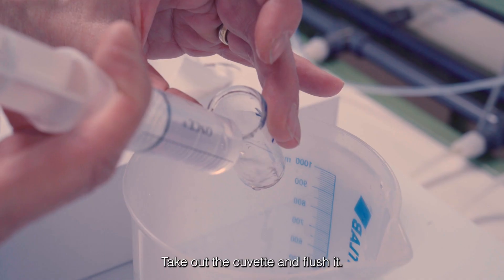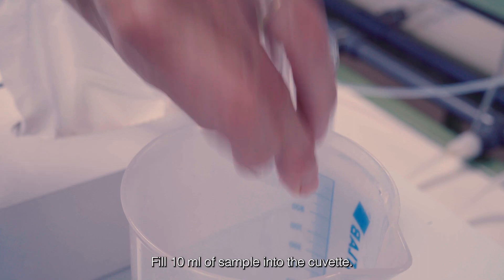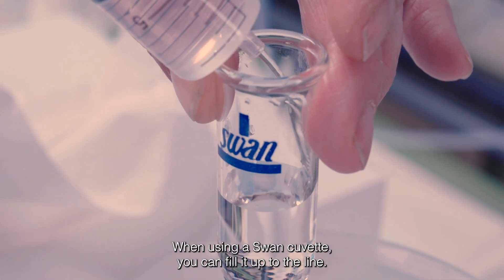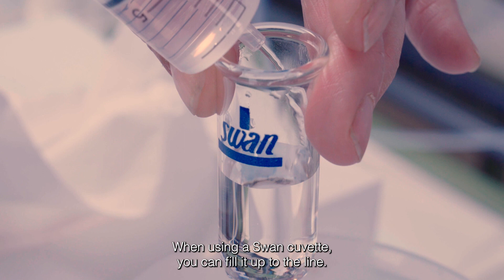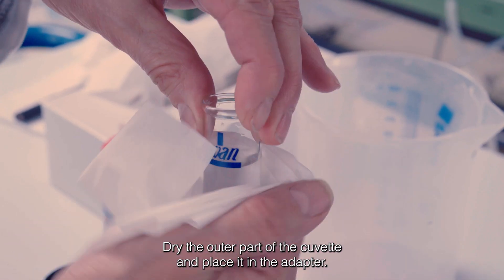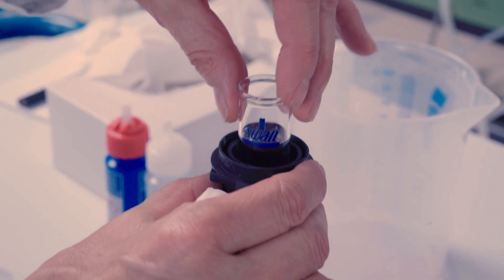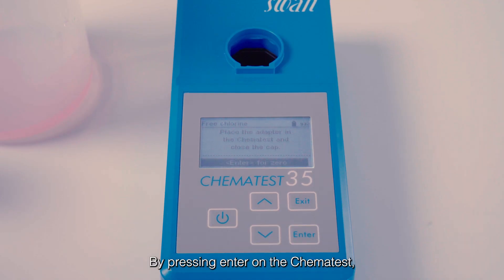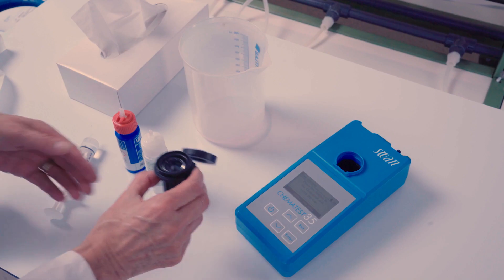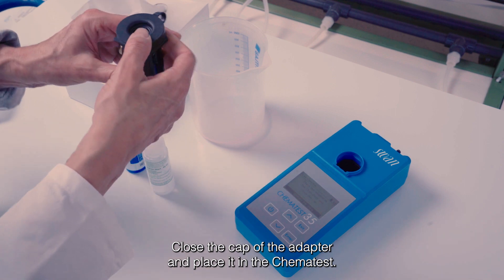Take out the cuvette and flush it. Fill 10 ml of sample into the cuvette. When using a SWAN cuvette, you can fill it up to the line. Dry the outer part of the cuvette and place it in the adapter. By pressing Enter on the chematest, you will receive the next instruction after each step.